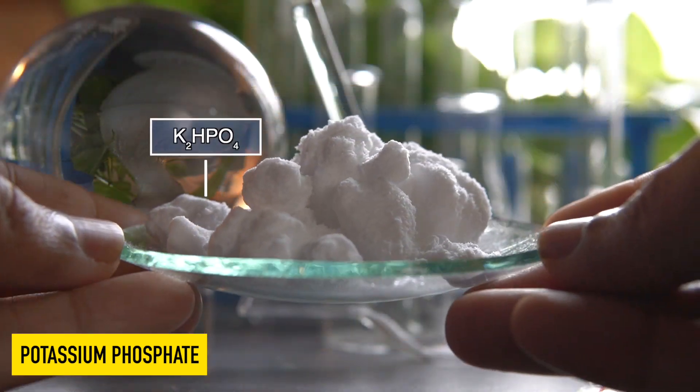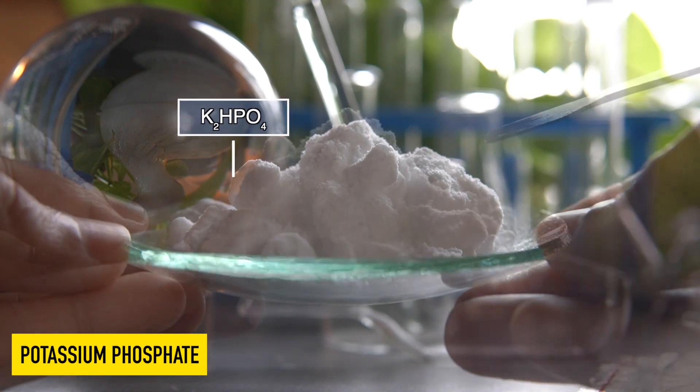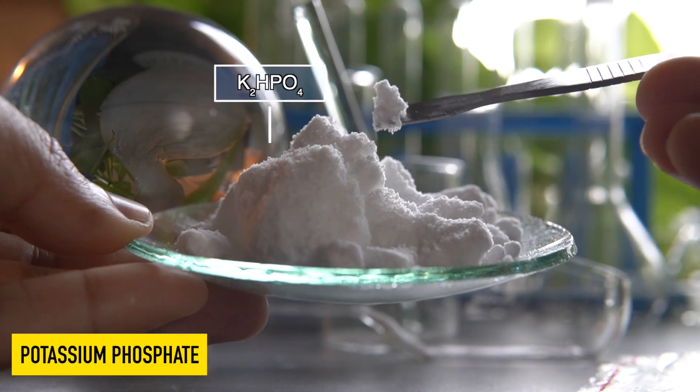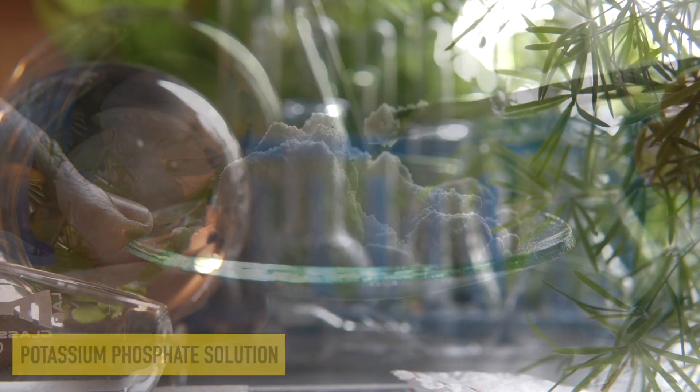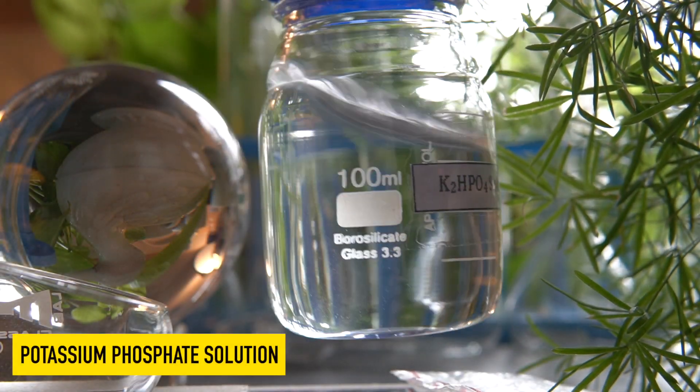These are potassium phosphate, white hygroscopic crystalline solids. They can easily dissolve in water to make a homogeneous clear solution.